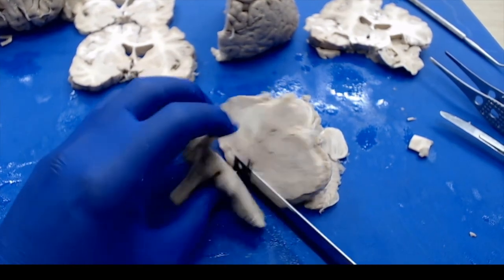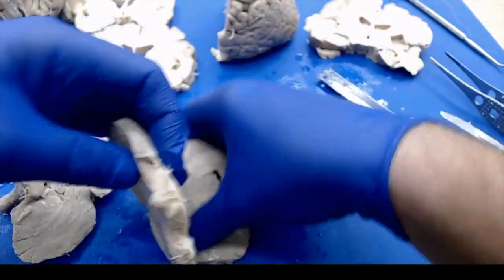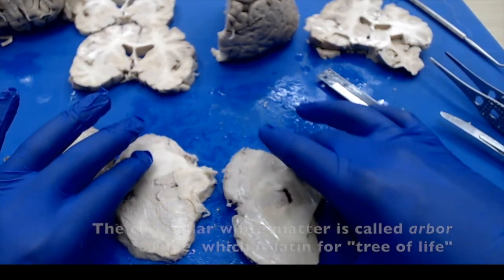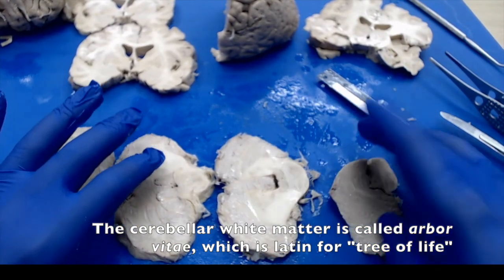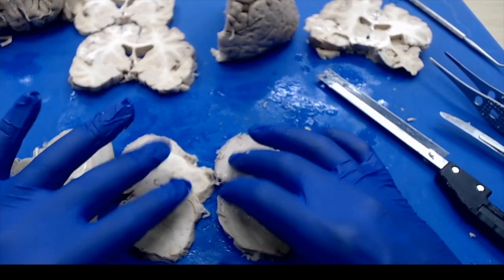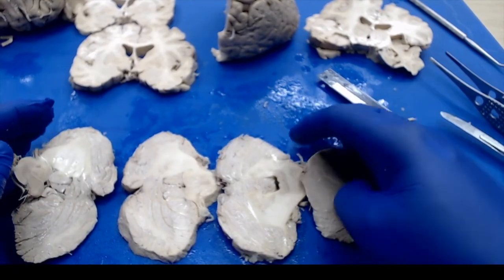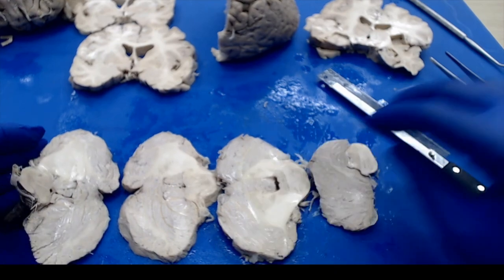We'll look for any sort of ischemia, look for signs of infarcts, maybe potential emboli in the vessels. Notice that the cerebellum has this nice little, they call it the tree of life, because it really looks very tree-like with leaves and stems and things like that. So you want to make sure that looks just like you should expect it to see here. This looks very normal. This person was in good health. And so the final section we'll take is from the cerebellum.